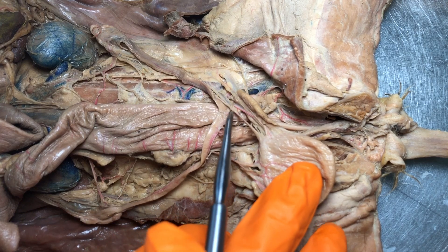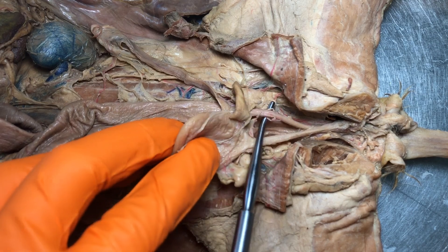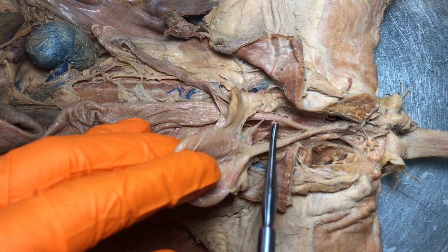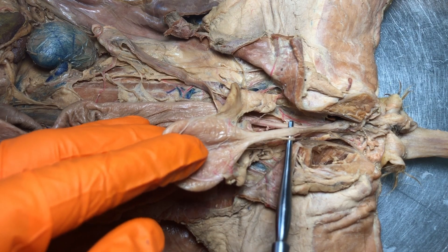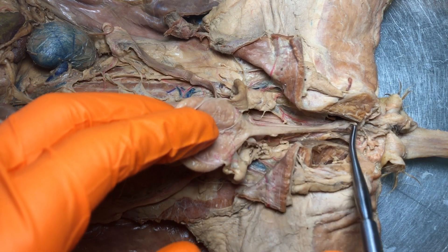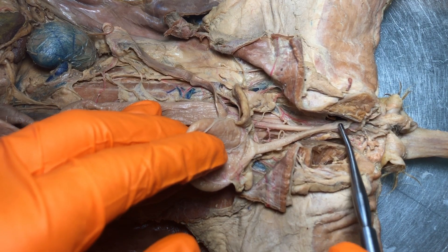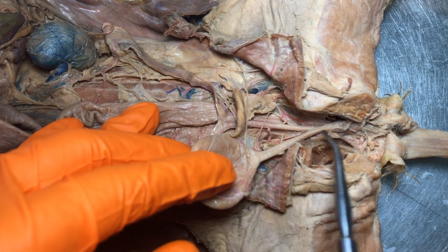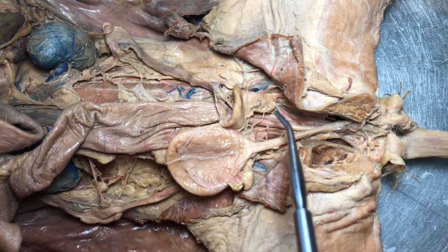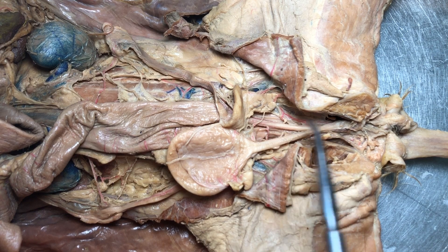Let's continue with the uterine body. If we follow this towards the caudal end, this little passageway right here is the vagina. We need to pay attention to what it's connected to, because this right here is the urethra — it's attached to that bladder. Now where the vagina and the urethra meet up, there's a single opening on a cat called the urogenital sinus. Think of urogenital as a compound word — it's essentially the open space that the urethra and the vagina have in common. Use your knowledge of the terms to help you picture what connects to what.